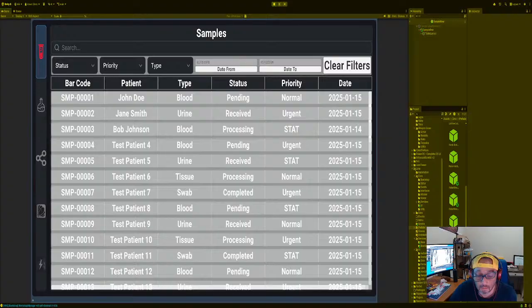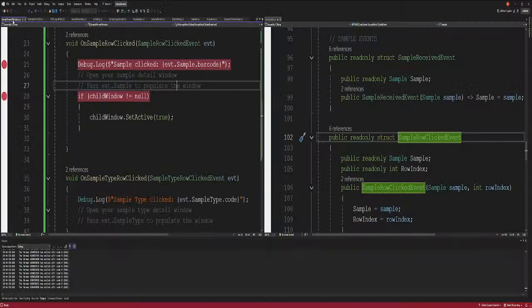I wonder why I got stuck. Maybe because it's debug. Yep, got stuck. No, it's not that stuck. Did I do a recursive error? Hope not. It'll be an example of not making a recursive error. All right, it's taking a long time. Okay, something went wrong. Let me double check on this thing here. Oh, I see what's going on. We actually got sample row display data. Okay, let me take that off for right now and see what happens.